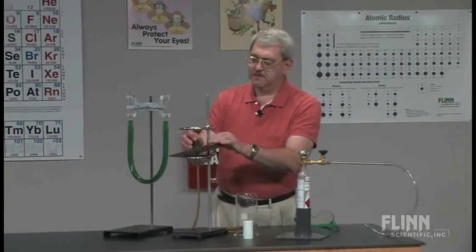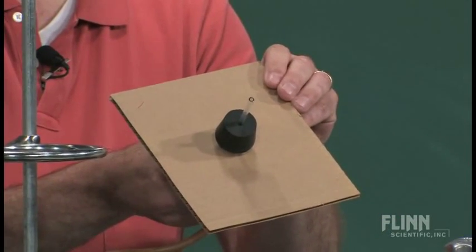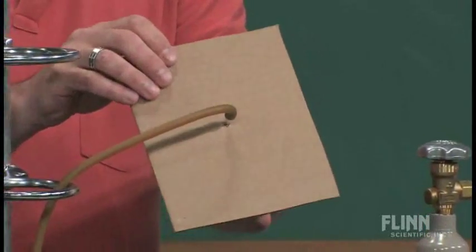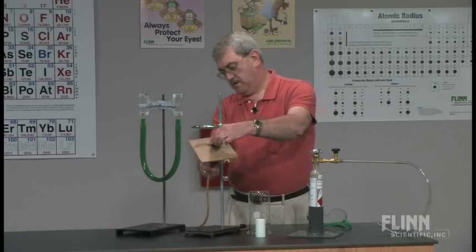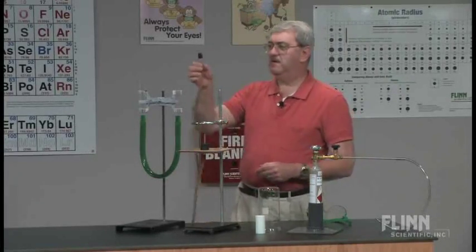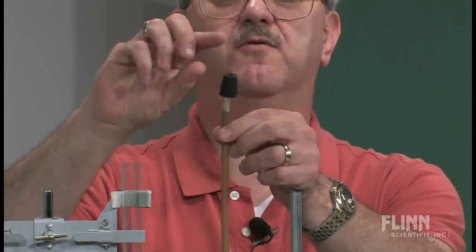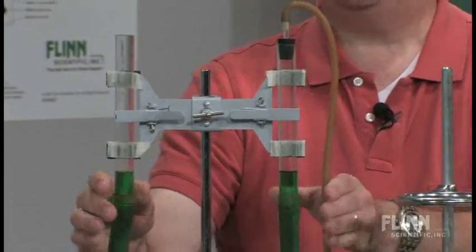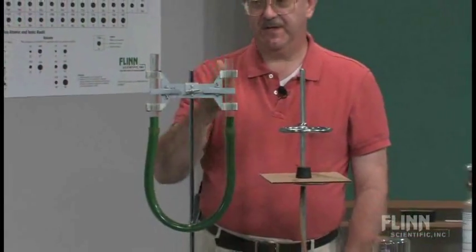We also have a one-hole rubber stopper that fits the porous cup, and through the stopper is a glass tube. The glass tubing is through a piece of cardboard, and the glass tubing is attached to a rubber hose. The cardboard supports the beaker. The rubber tubing at the other end has a piece of glass tubing through a stopper, which is a one-hole stopper, and fits into this U-tube. The U-tube is flexible, and you want to make sure that you get this apparatus introduced to the students prior to this demonstration so that they know what this equipment is all about.